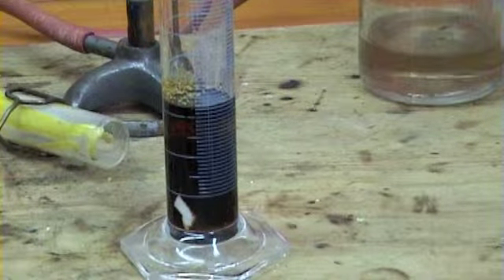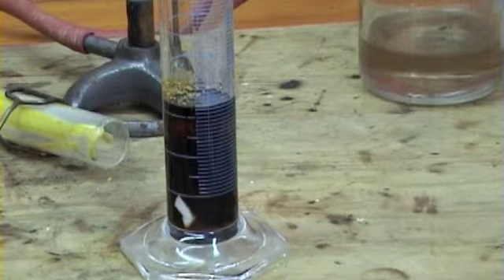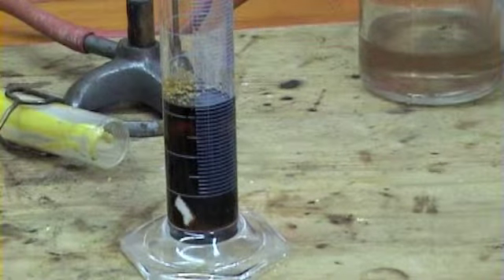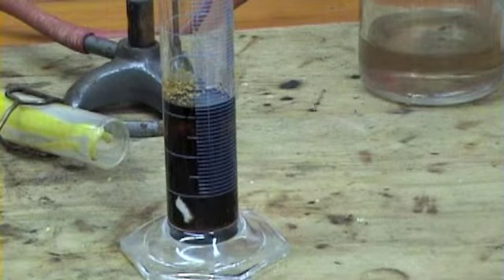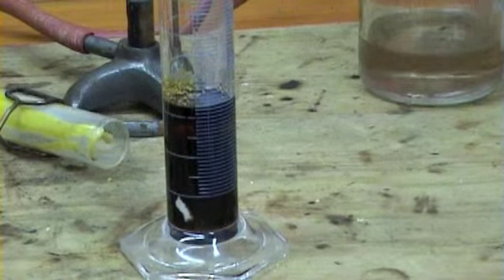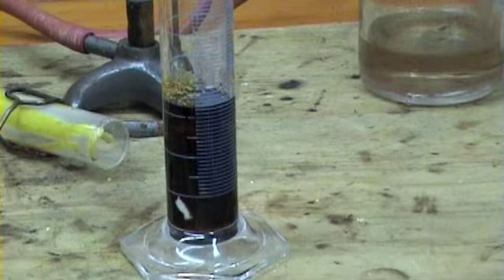Put your finger in and see what the temperature is. No, you just said it's 140 degrees. Around the outside. Oh, I want someone to put their finger in there. Troy? Yeah. What class are you reading?